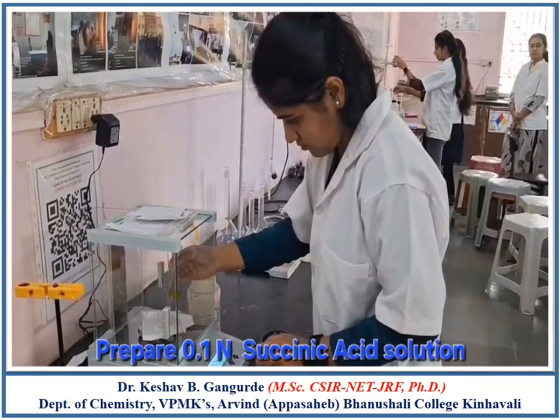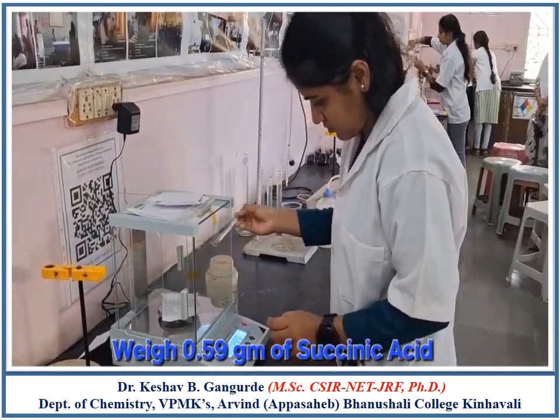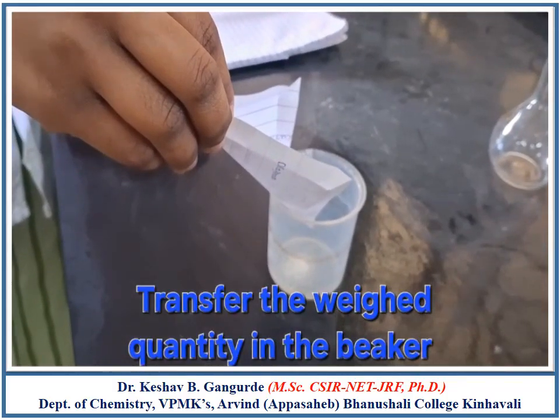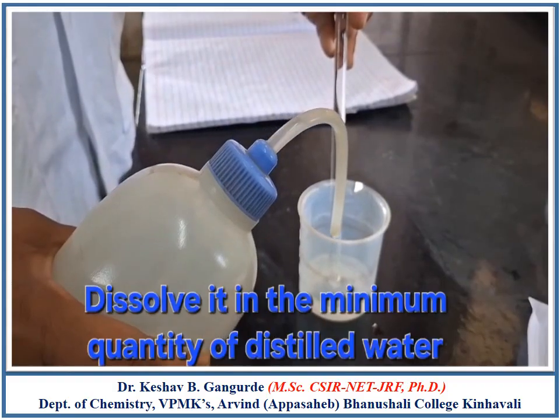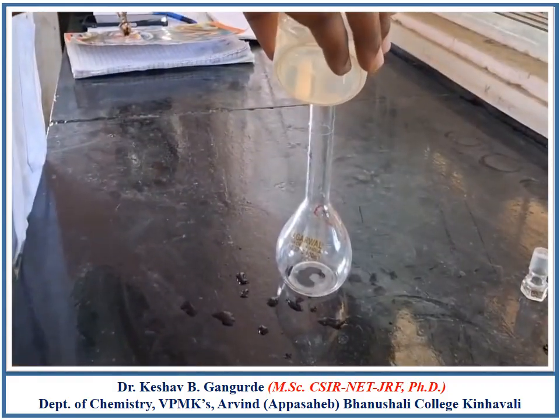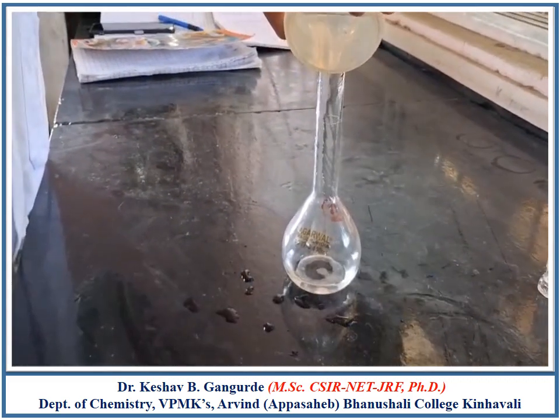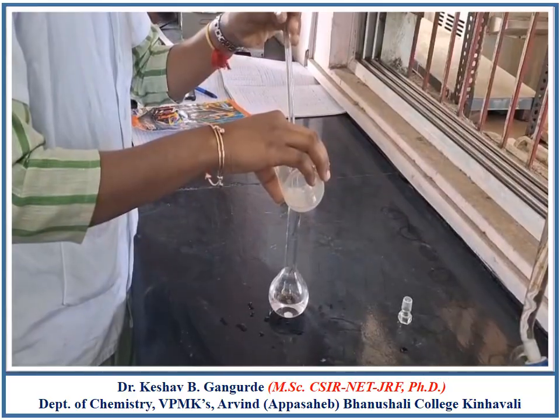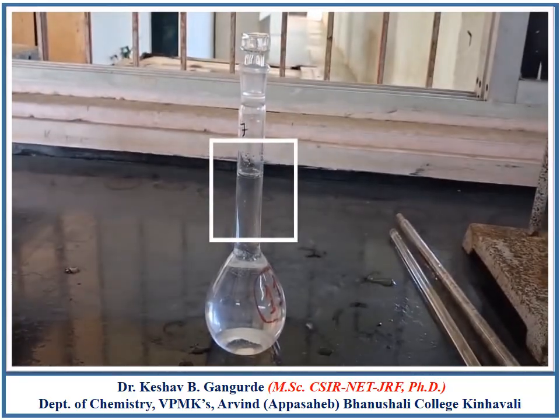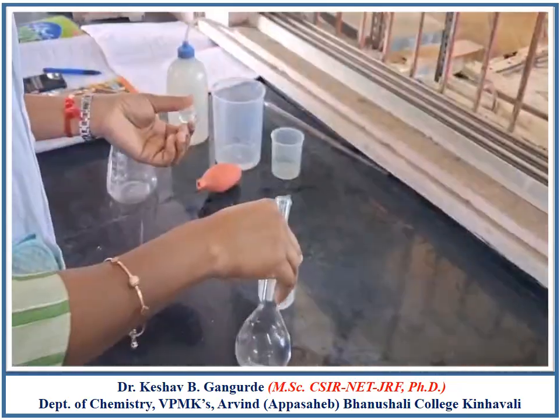Now to prepare 0.1 normal succinic acid, weigh 0.59 gram of succinic acid. Transfer the succinic acid in the beaker and dissolve it in minimum quantity of distilled water and dilute in a 100 ml standard measuring flask up to the mark. Shake the flask vigorously to make a homogeneous solution.